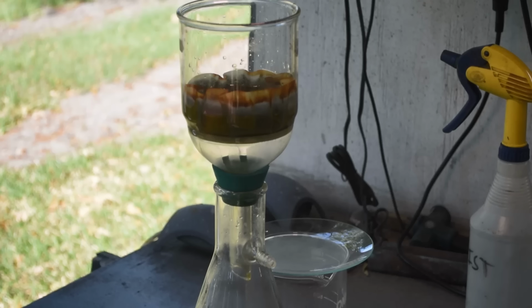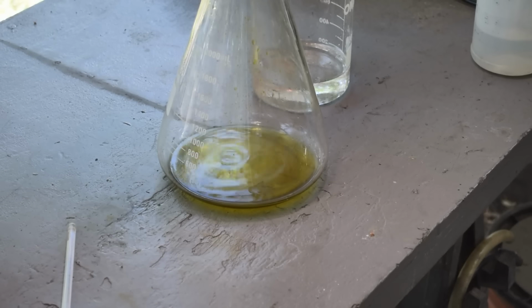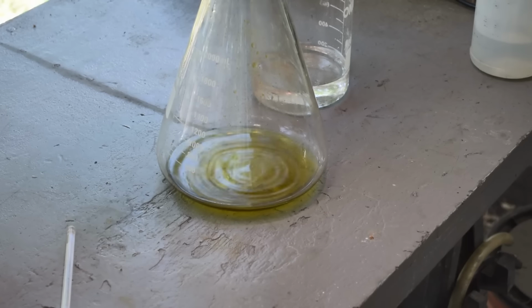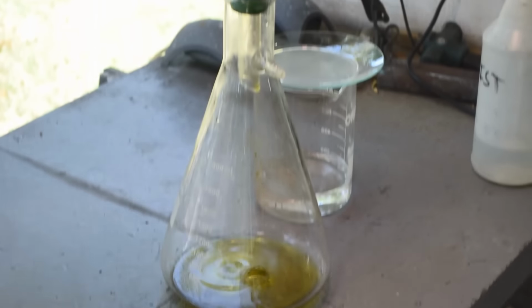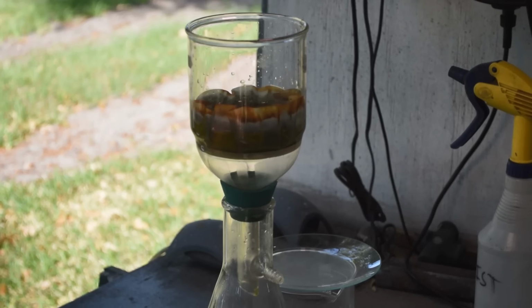So we'll just let this go. Like I said, once this goes through once, I'll run it through a second time. And then I'll run some rinse water through to get the green stuff out of it. And then we should be ready to dissolve the gold.